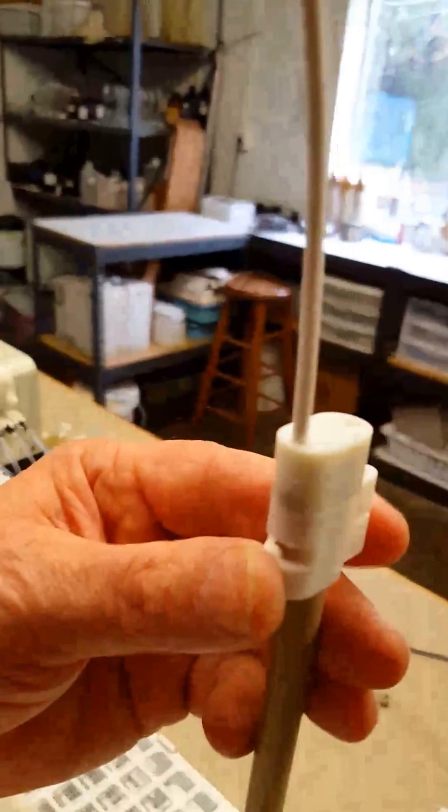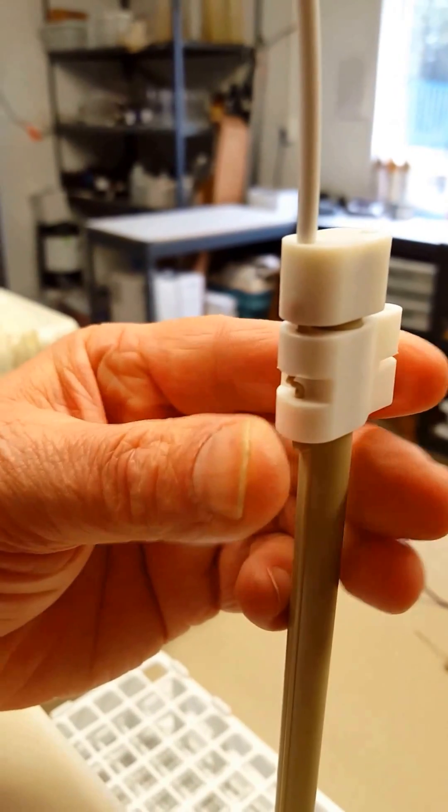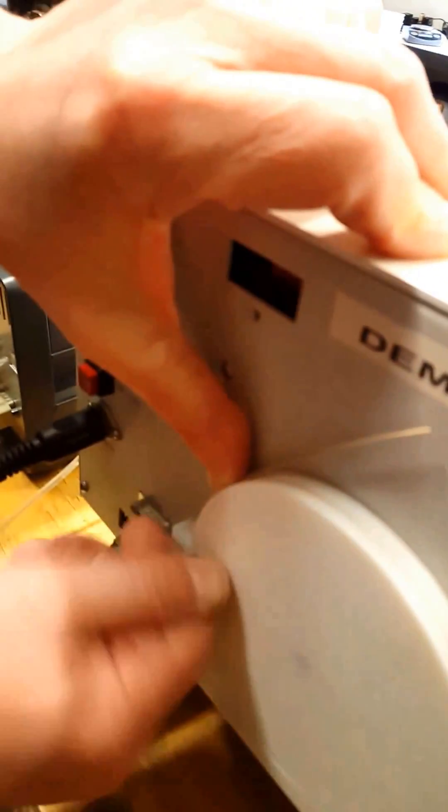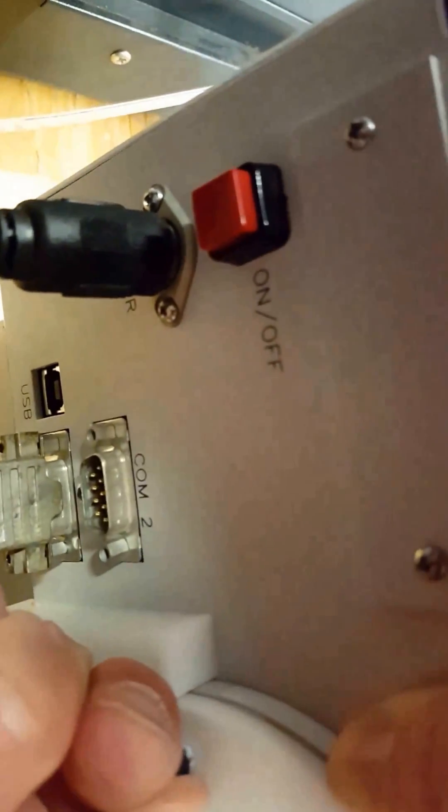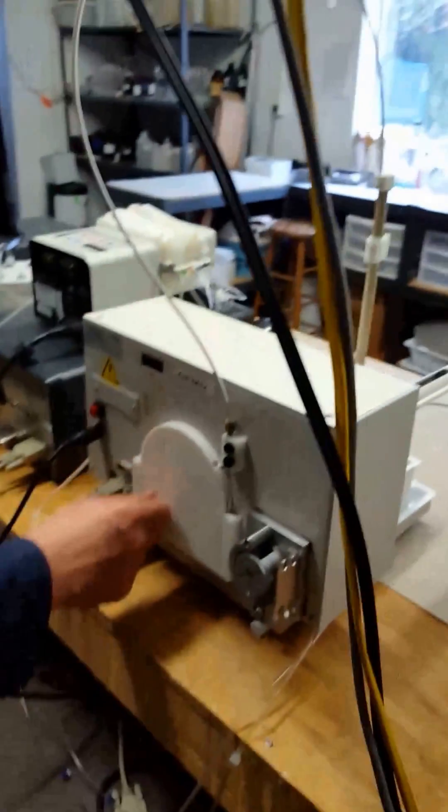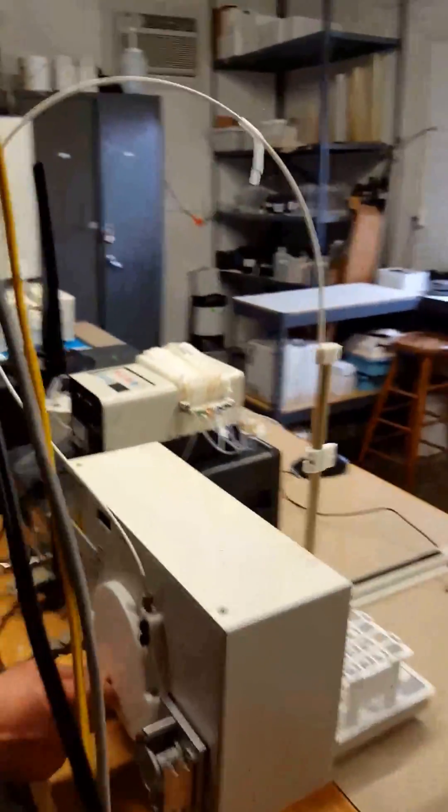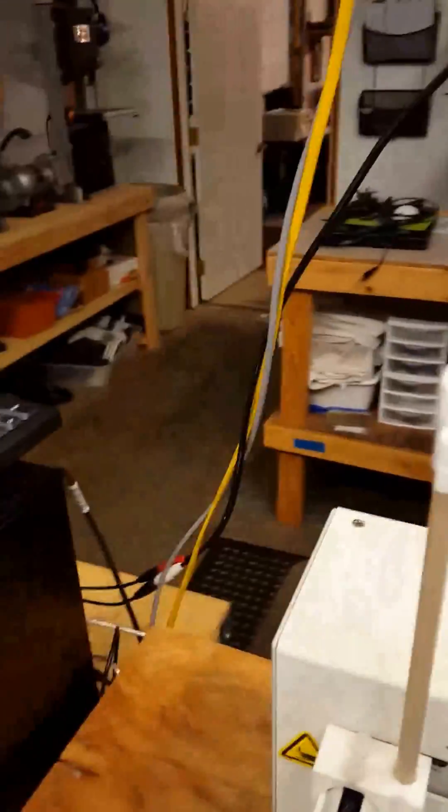You're going to adjust this so that it has about three millimeters, then tighten the clamp down. You'll see there's a little latch that goes over the tubing. The wheel is actually how the probe is driven on the motor on that back wheel.